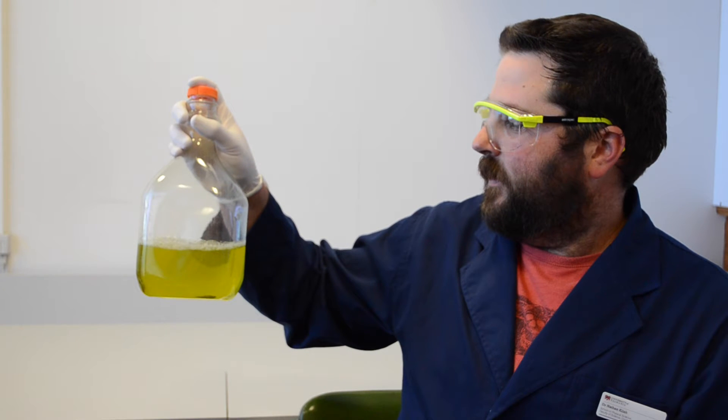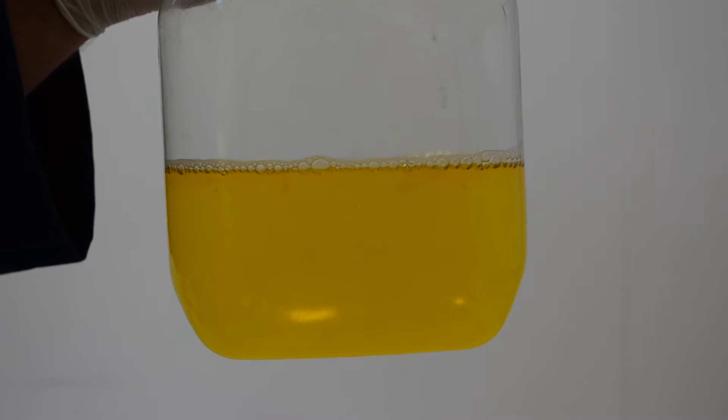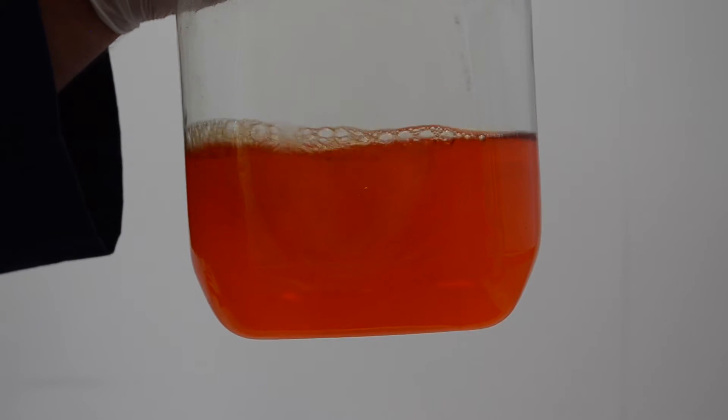Let's see that again up close. Small shake, orange to red. A large shake, red to green.